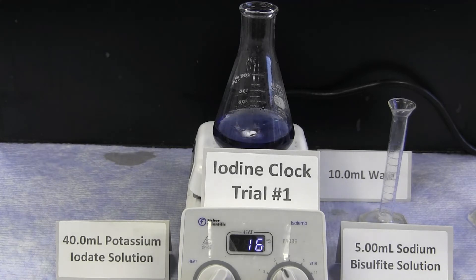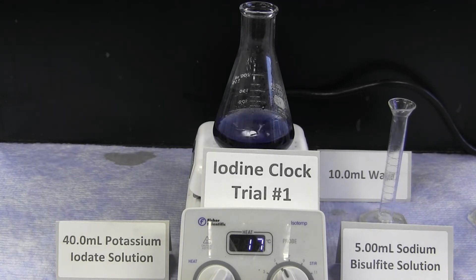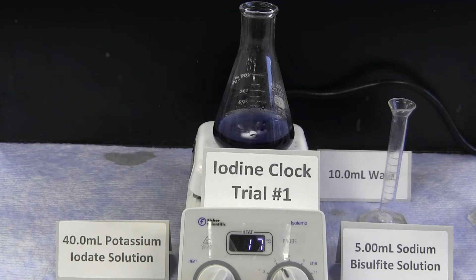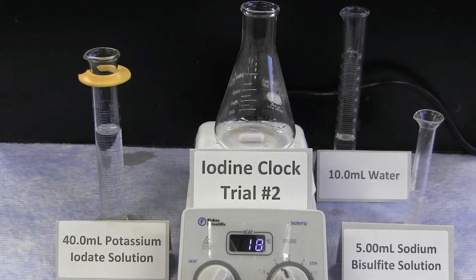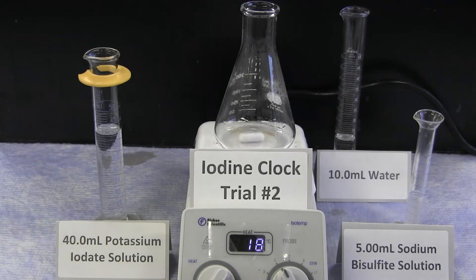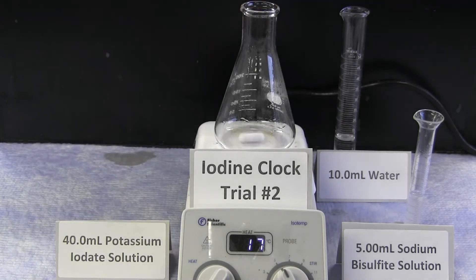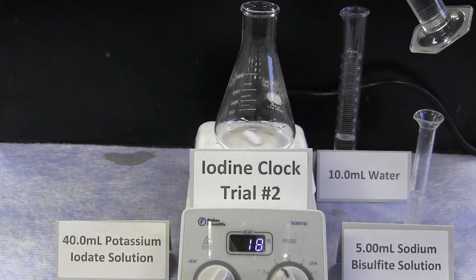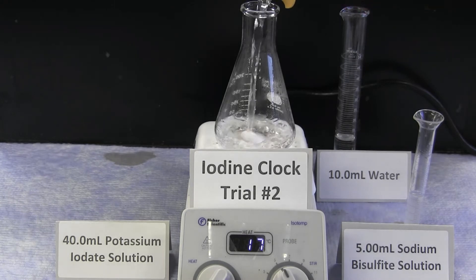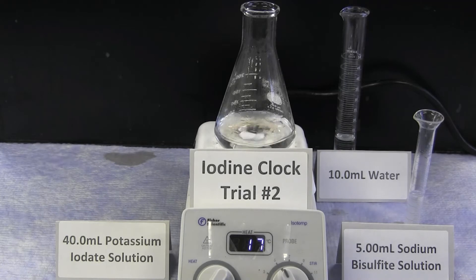Overall, the blue color represents the product of iodine. A second trial using the same volumes and concentrations is then performed in order to obtain an average reaction time for these concentrations.